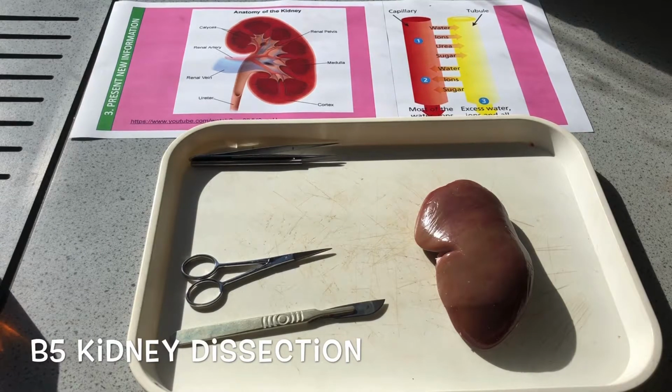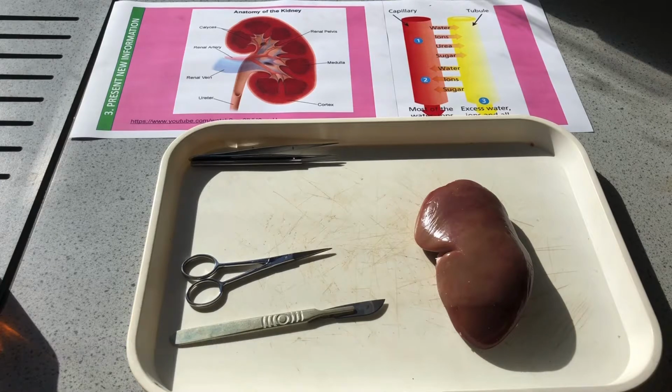This is a triple science video from the topic B5 looking at kidney dissection. So we're going to take this kidney, dissect it, and also discuss what happens inside the kidney. The primary function of the kidney is to filter the blood.